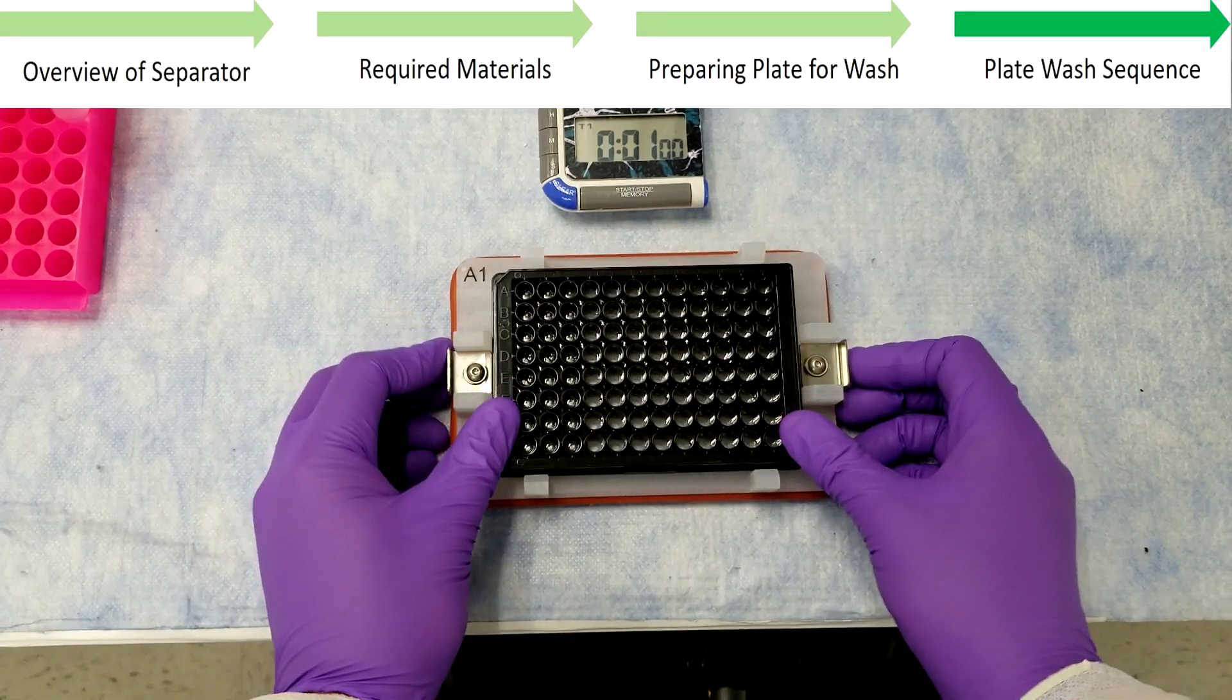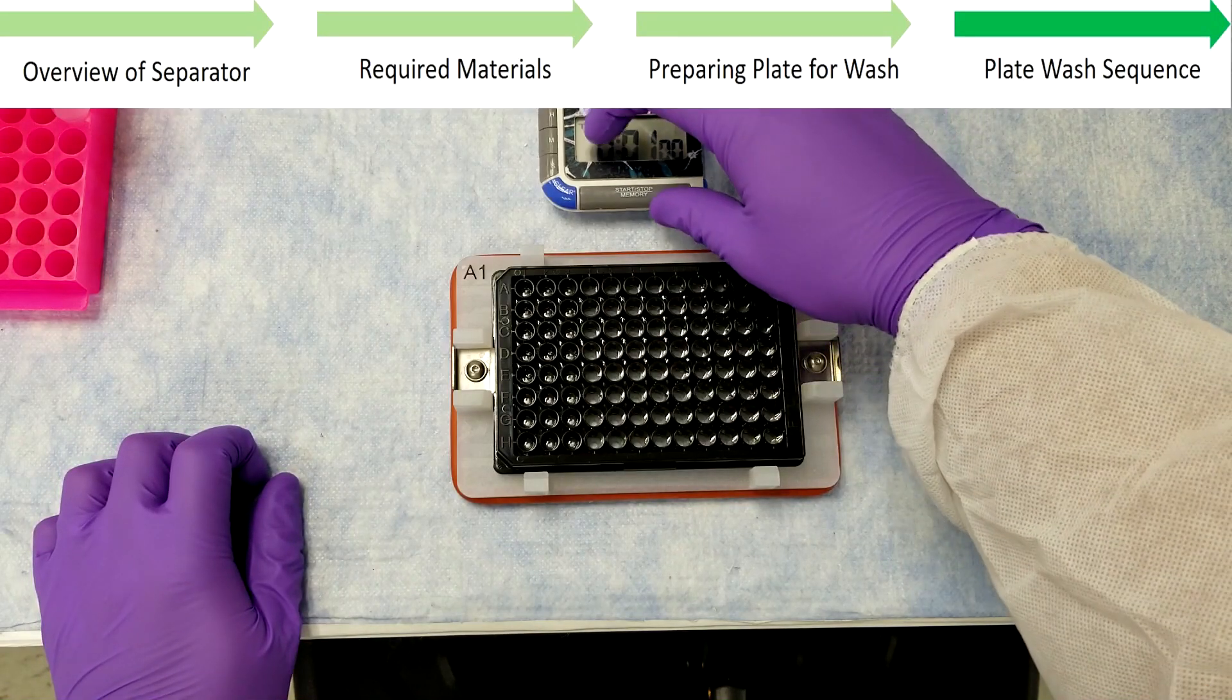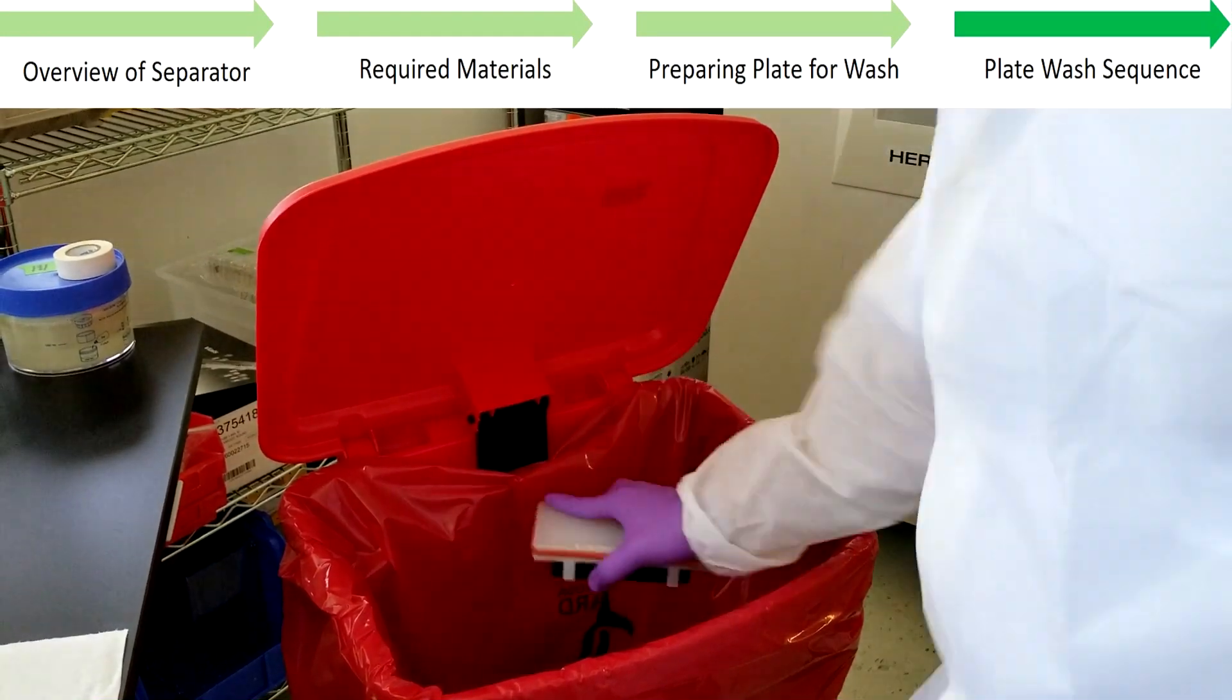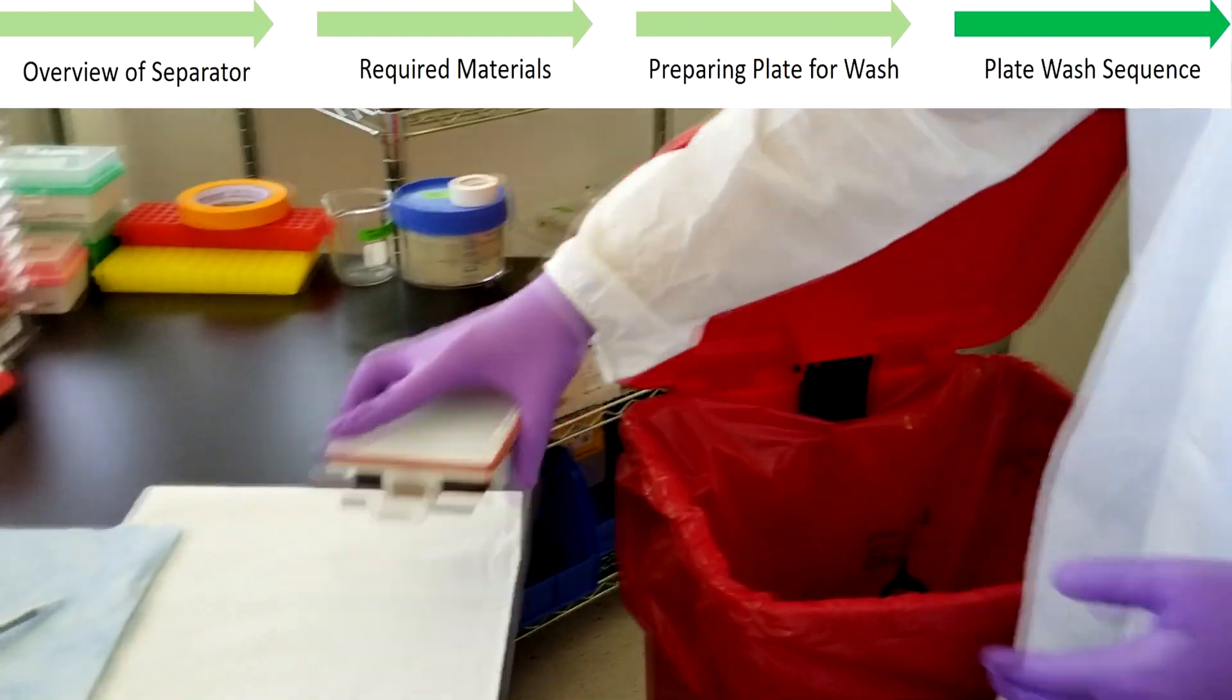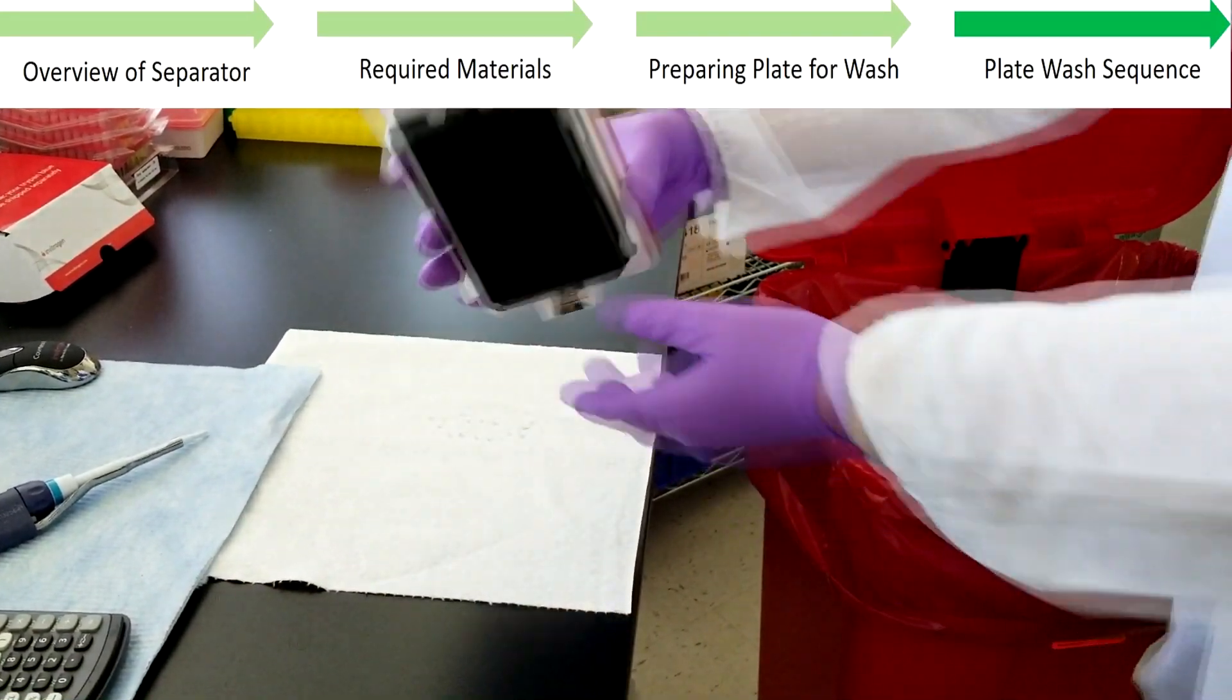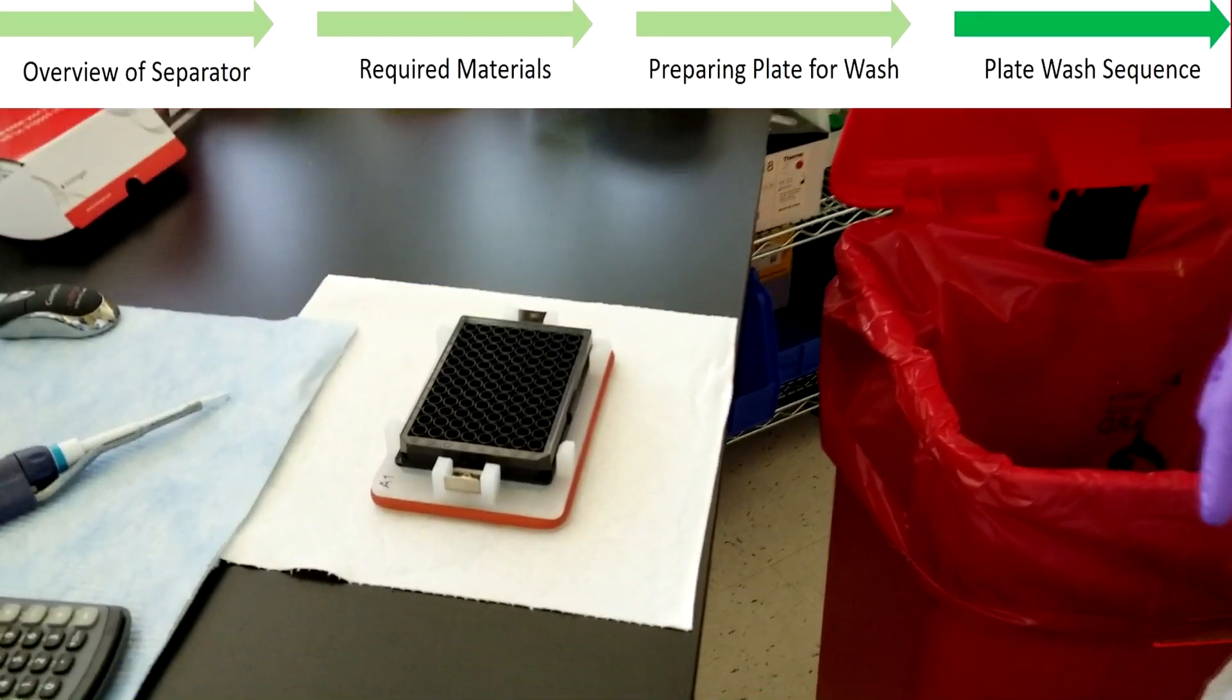Secure the plate back on the separator, again incubating for 60 seconds to ensure that the beads are fully retained. Subsequent decanting of wash buffer will complete one wash sequence. This cycle should be repeated as many times as directed by the kit protocol before proceeding to the next assay step.